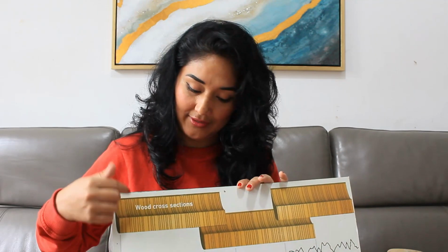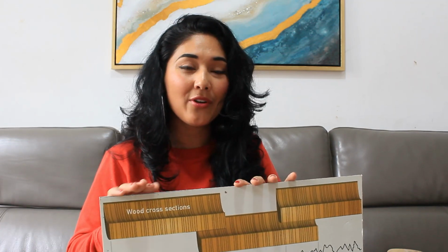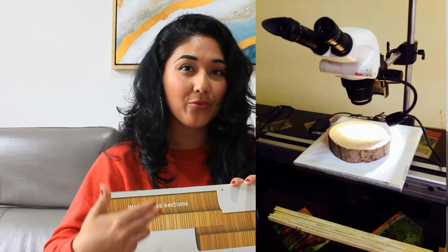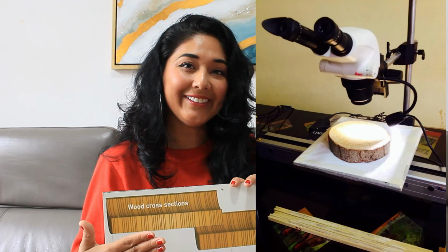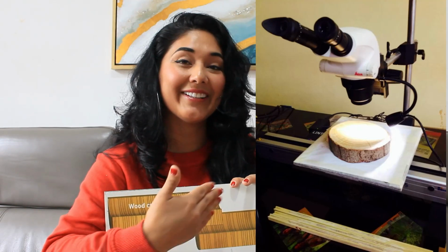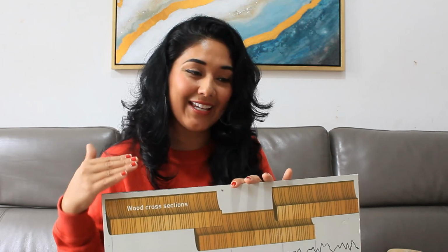This is possible when we are using a tree-ring measurement table. For example, linked to the table it is possible to accomplish our file or data, and afterwards we can achieve our chronology data to obtain our master chronology and correlate with different variables of interest.